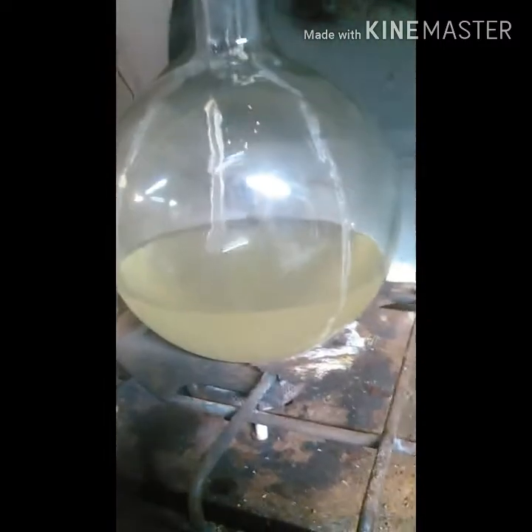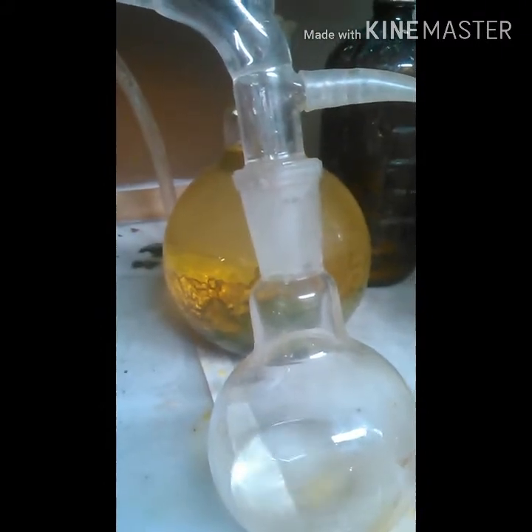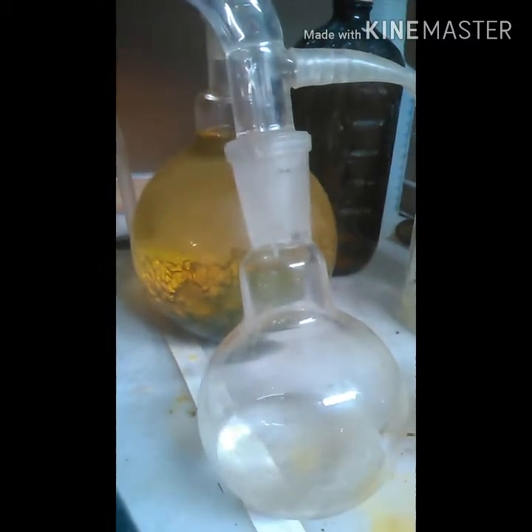You can see there's no boiling going on here at all at this point and it's still just dripping away from the vacuum. Just by manipulating these two back and forth — which is kind of a pain but it works — and it is working well.